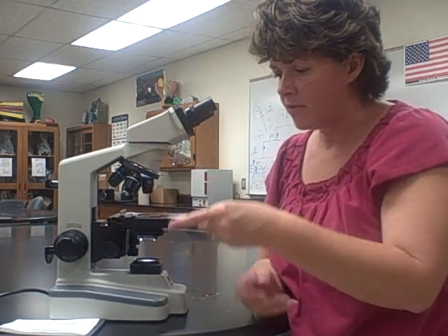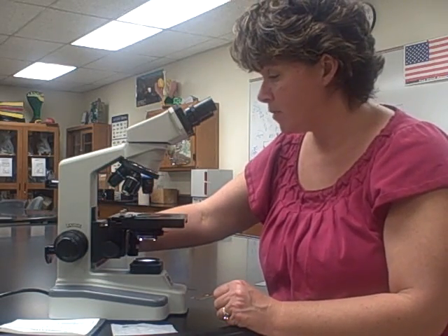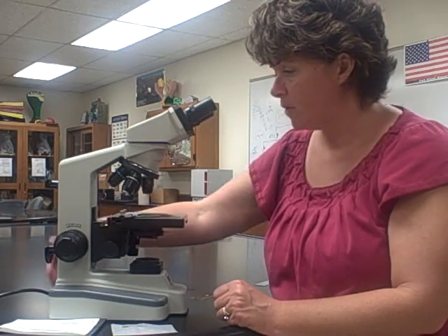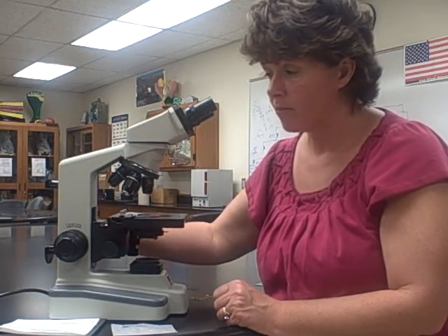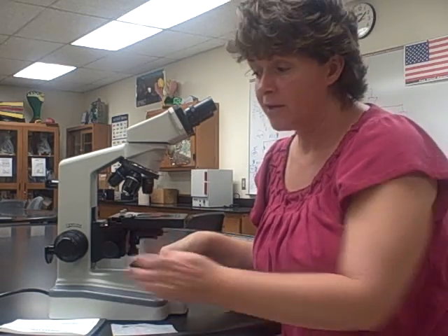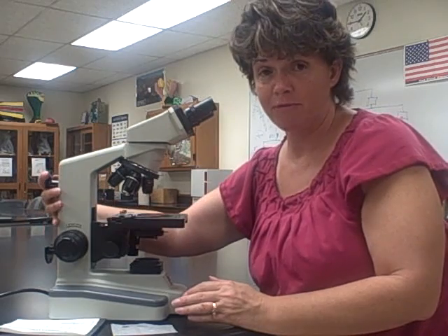If you're ever concerned, check the 40x objective to make sure you didn't get oil on it. When your microscope is clean and you're done, put it away. Remember to turn the power off, set it to the 4x objective, lower the stage all the way down, unplug the cord, wrap it around the back, put on the dust cover, and carry it with both hands back to where it belongs — placing it in the slot matching your number. When putting it into the case, the objective lenses go in first and the cord faces you.